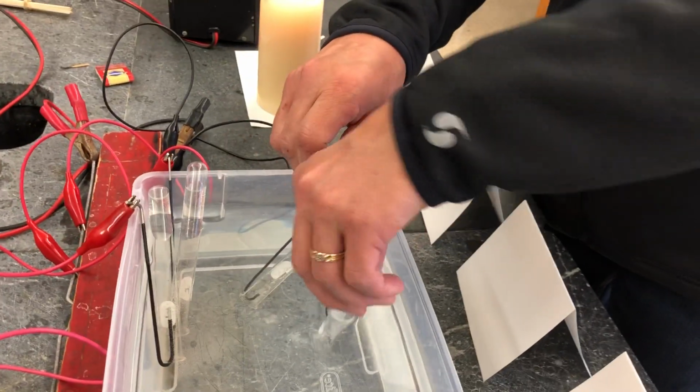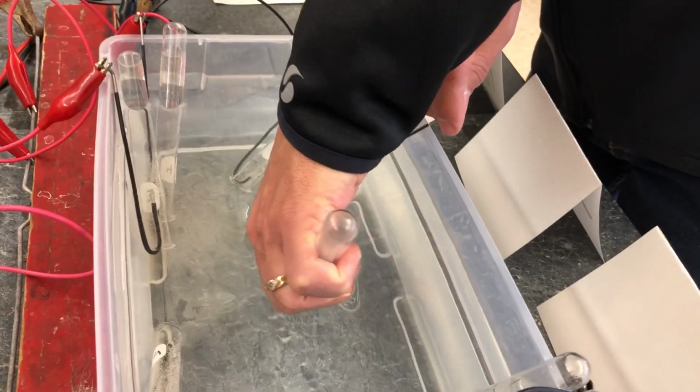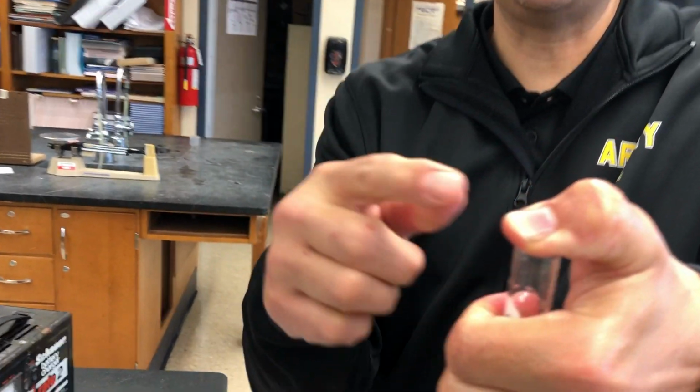And so what I'm going to do is I'm going to put my hand in there. Mr. Wise, are you telling me students would have been able to put their hand in there and do this themselves? Absolutely, absolutely. Dang it. And I am bringing this up here. Notice that I've trapped that gas right there. Now I'm going to keep my thumb over it as I go here, and I've trapped that gas.